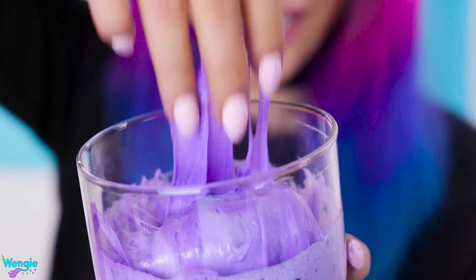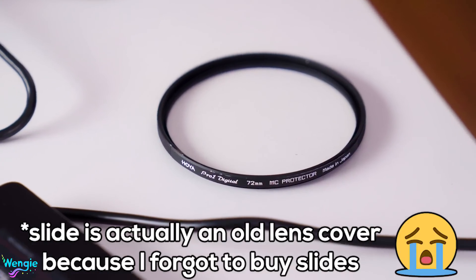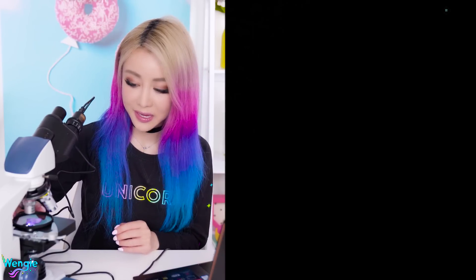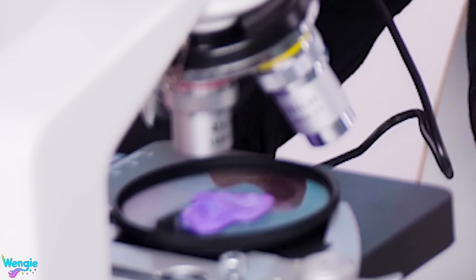It's so fluffy! Now I have it all over my hands. When you stop playing with it and put it on the slide — I think this much would do. Alright guys, we got the slime on the slide — ooh, alliteration! We're gonna slide it — it's black. I realized that usually with these scientific things you smear a super thin layer of whatever you're looking at, so the light at the bottom shines through and makes the thing see-through. But we have a huge wad of fluffy slime and the light is having trouble going through.